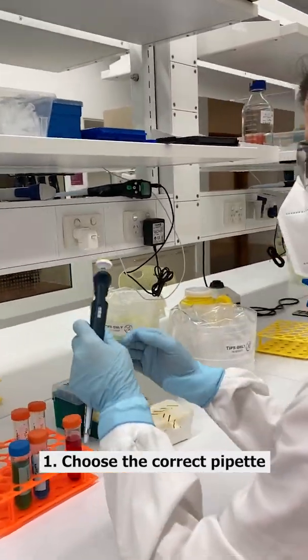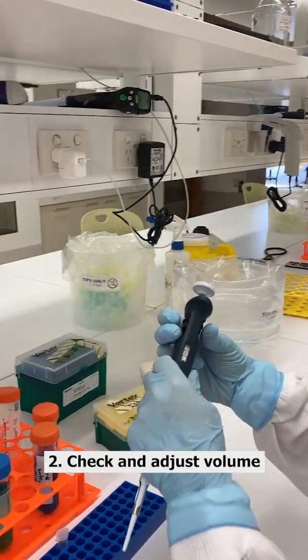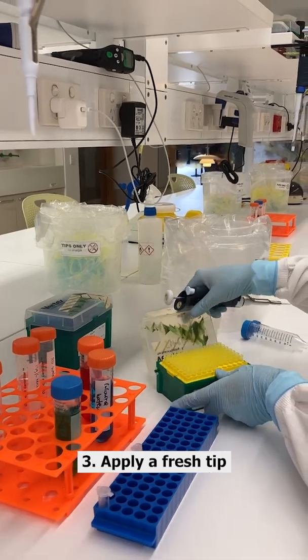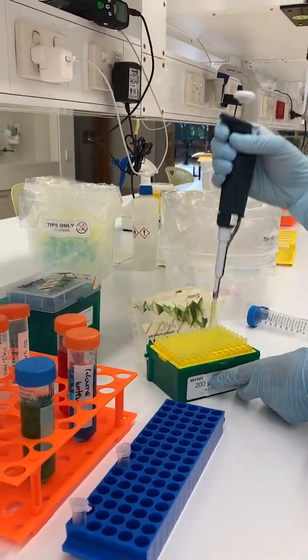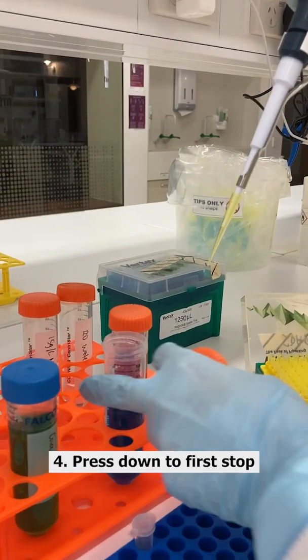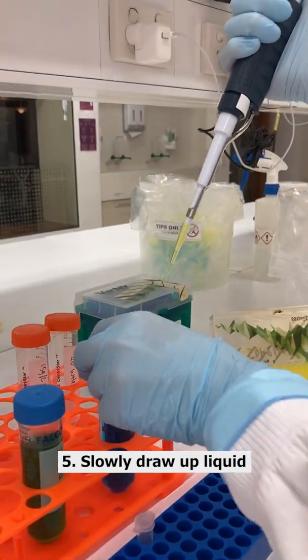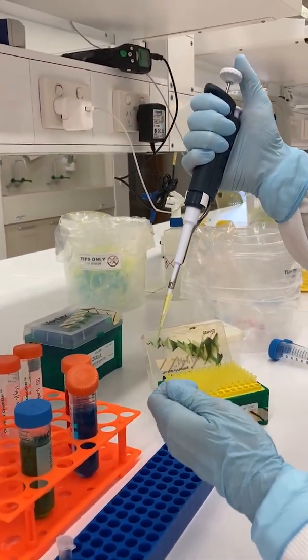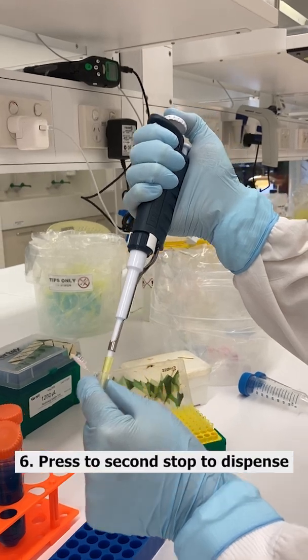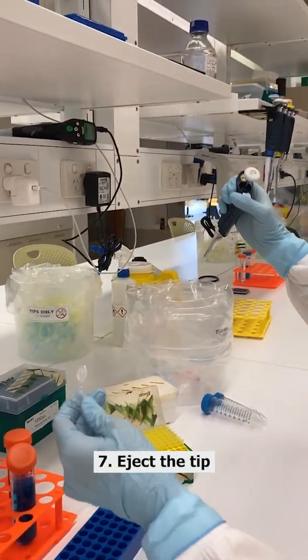First, choose the correct pipette and tips for the required volume. Check the volume and adjust if necessary. Apply a fresh tip. Press down to first stop. Slowly draw up the liquid by releasing the plunger. Place the tip inside the recipient container and press the plunger until the second stop to expel the liquid. Keep your thumb down until clear of the liquid, and then finally eject the tip.